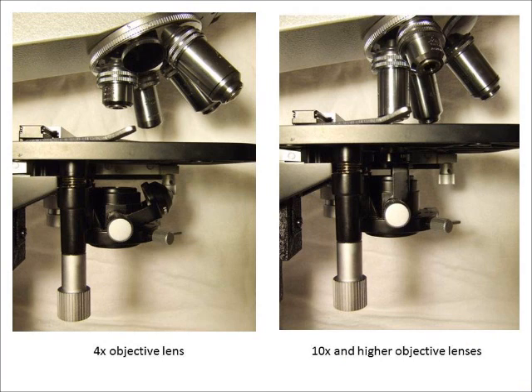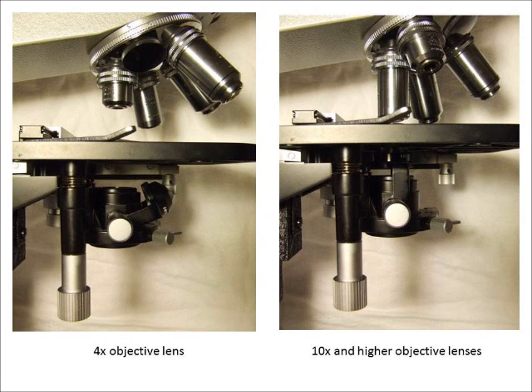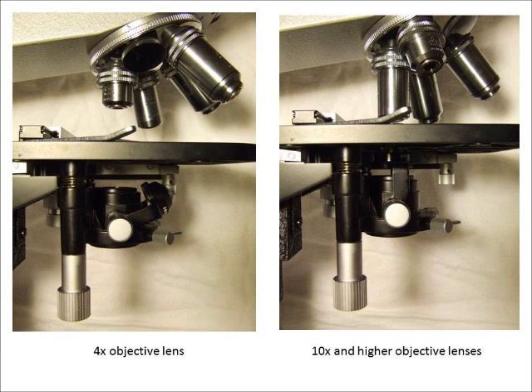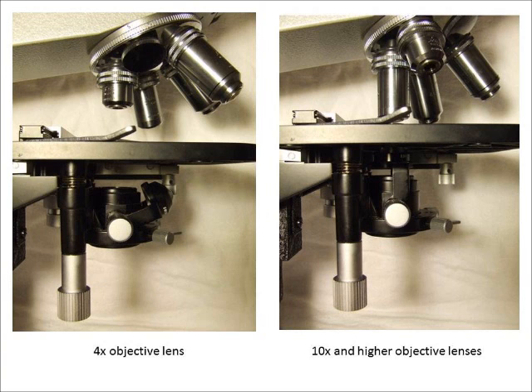And if you don't remove it for the 4x objective lens then your field of view will be greatly diminished. This slide shows how the extra condenser lens should be set up for different types of objective lenses. The photo on the left shows the correct position when using the 4x objective lens, and the photo on the right shows how the extra condenser lens should be rotated into position when using a 10x or higher objective lens. Please remember this.